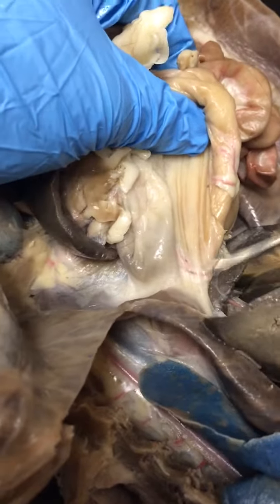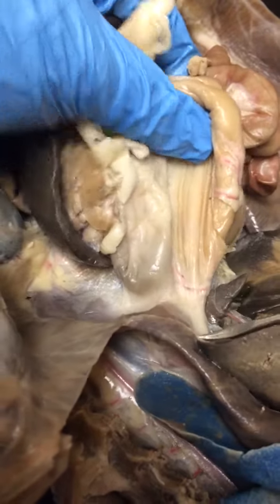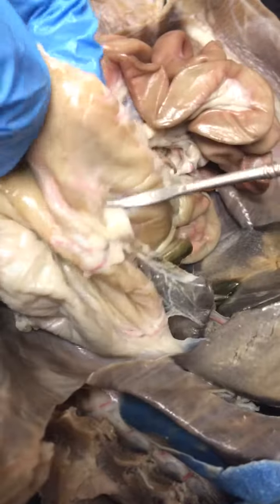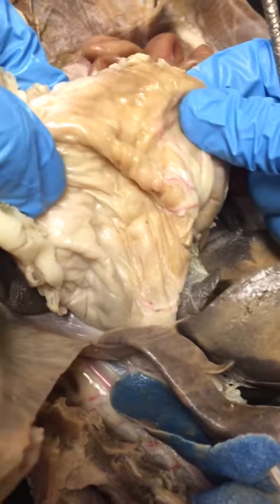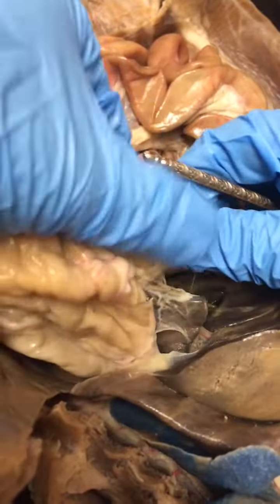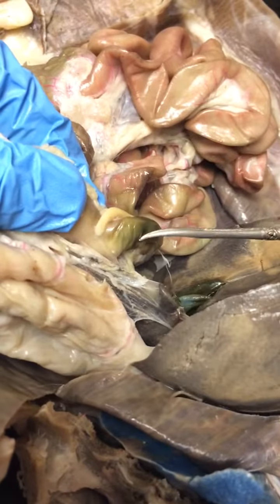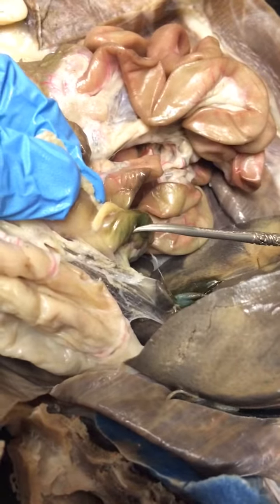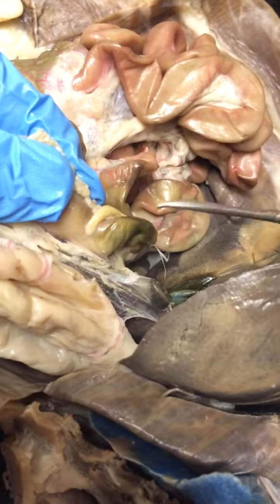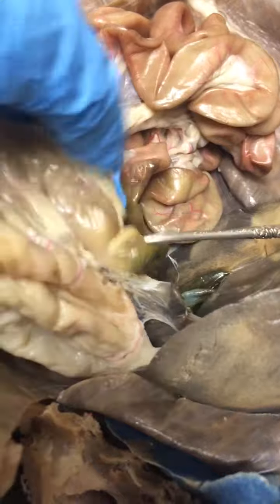a little bit of the, what's it called? The esophagus, okay? And that'll connect to your stomach. All right, so this is your stomach right here, this huge kind of sac. The stomach starts the small intestine. Okay, so you see this green part of the small intestine? That signifies that this is the duodenum. All right, so the duodenum is the first part of your small intestine.